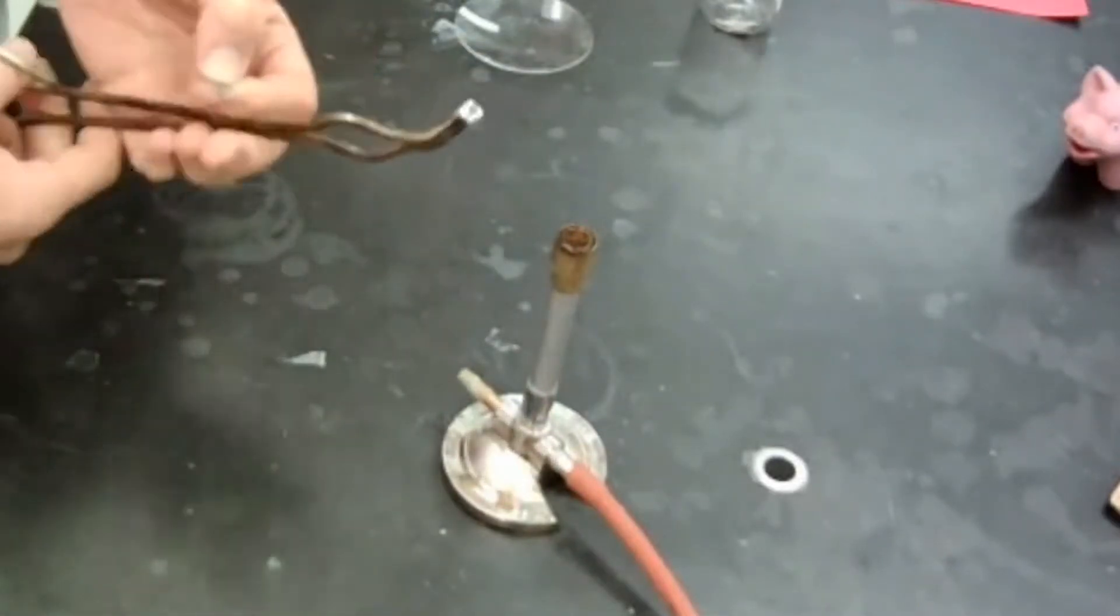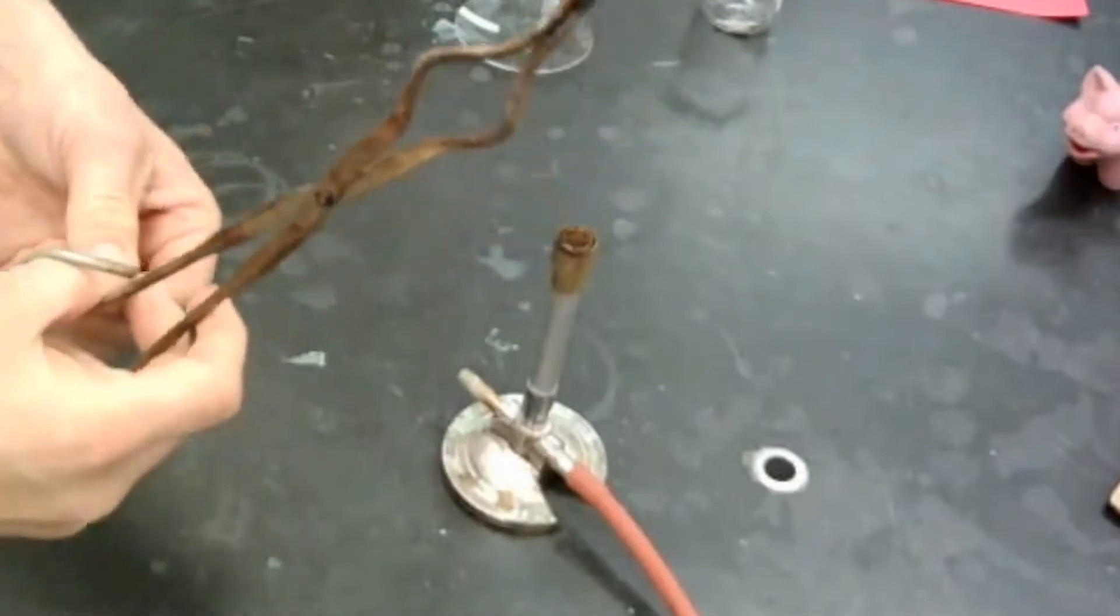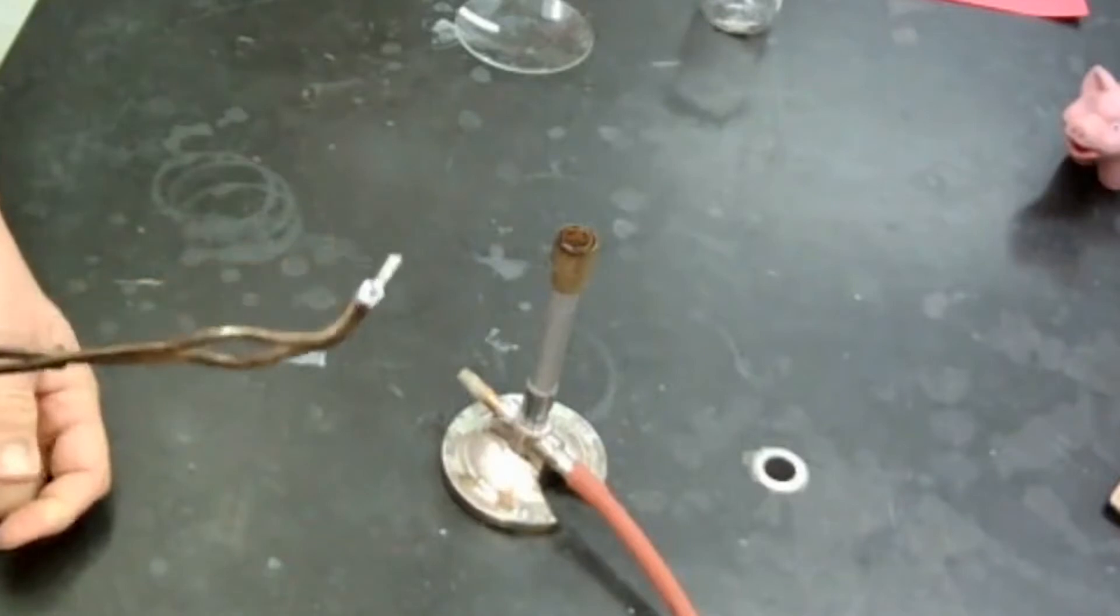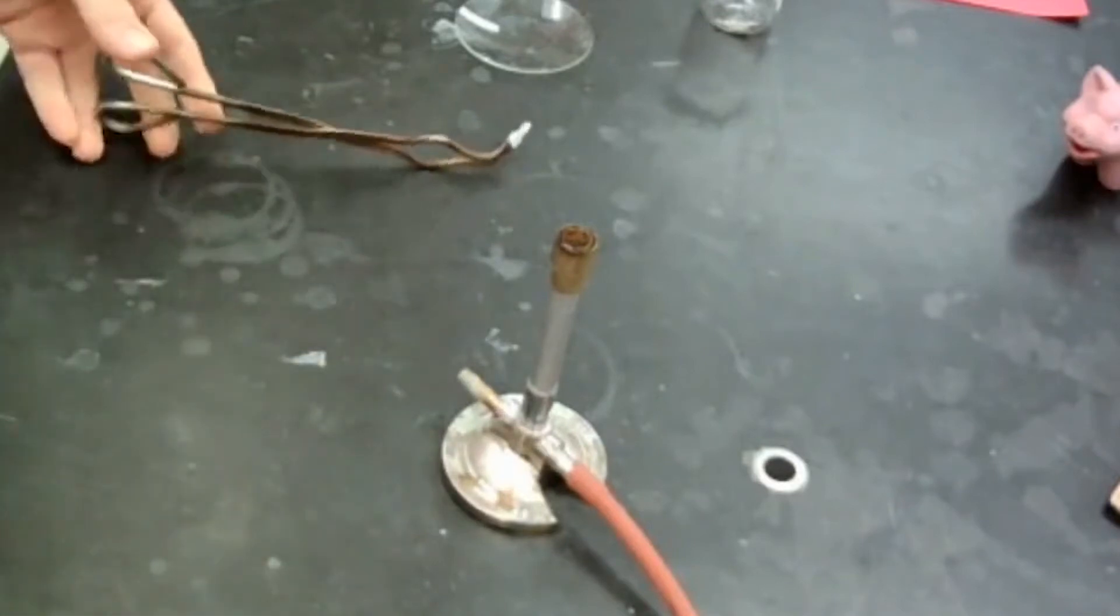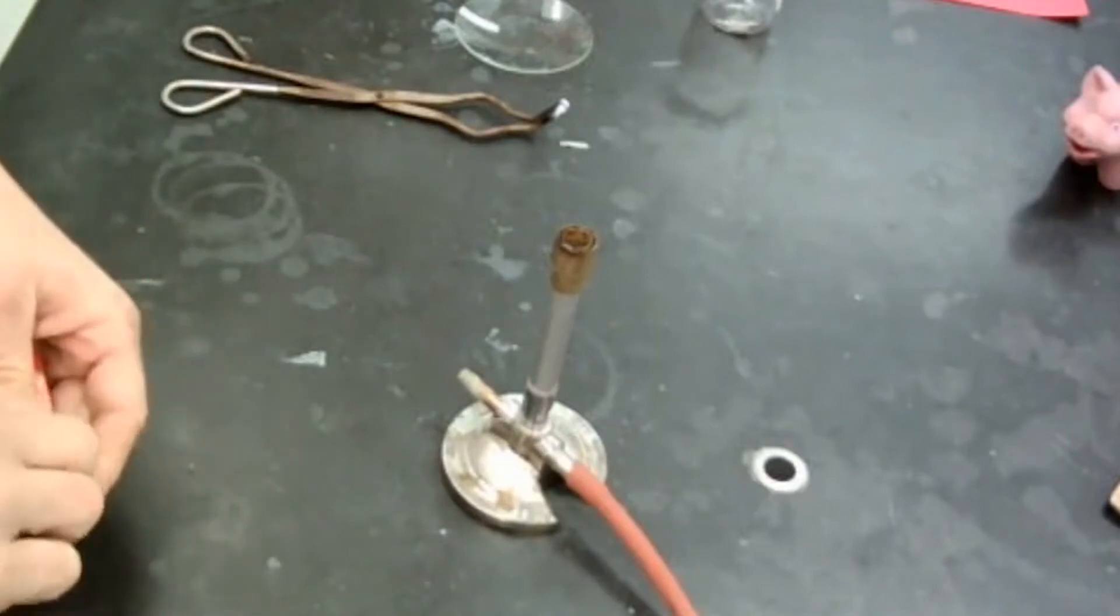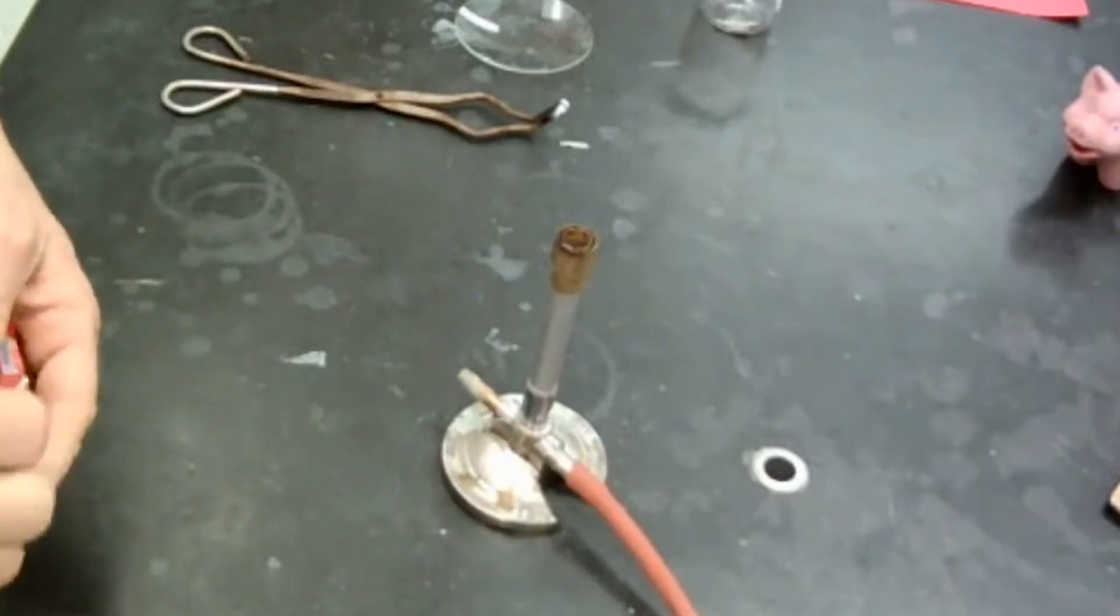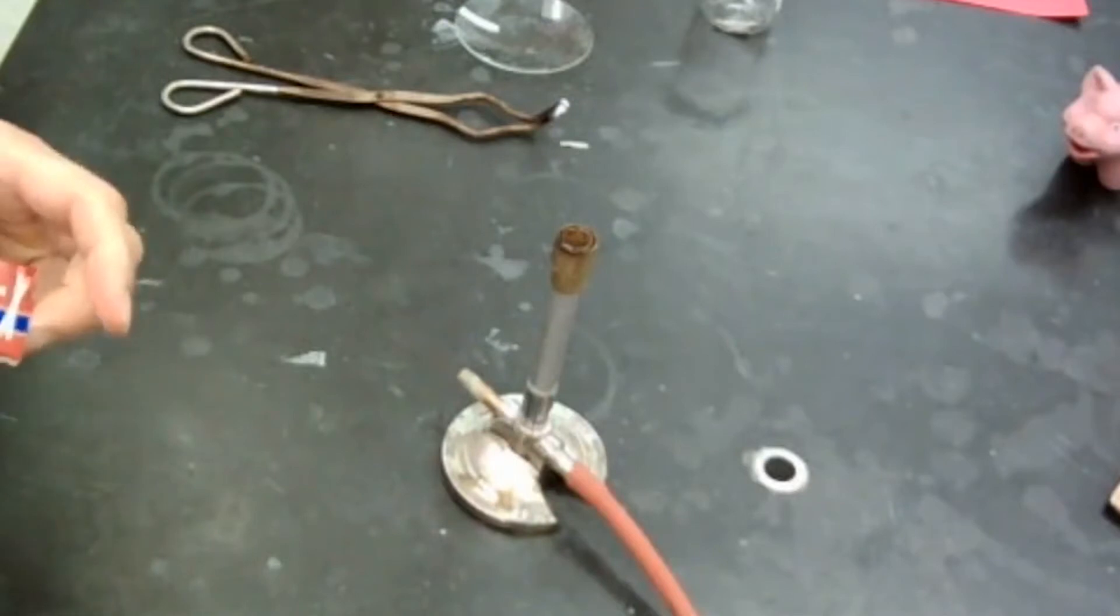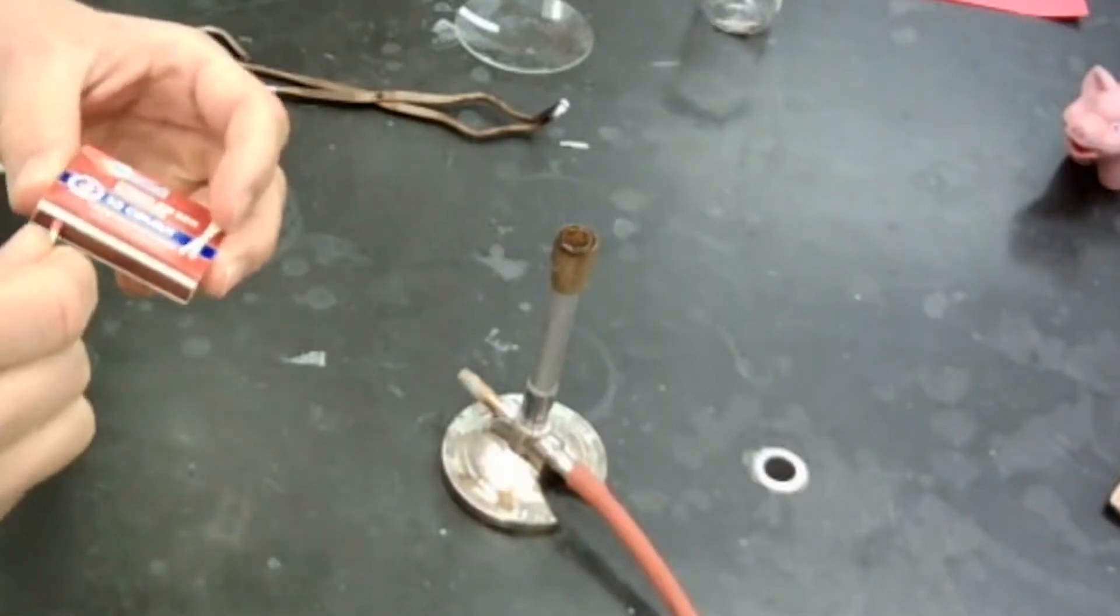So let's go ahead and without further ado, really get this thing going. So I'm going to burn this magnesium. I'm just going to put it in between the tongs here. And then I'm going to light my Bunsen burner. And I'll use the Bunsen burner because oxygen in the air is already bonded to itself. So the oxygen in the air bonds to other oxygen molecules. And we're going to learn about a diatomic molecule today. Oxygen is one of them.